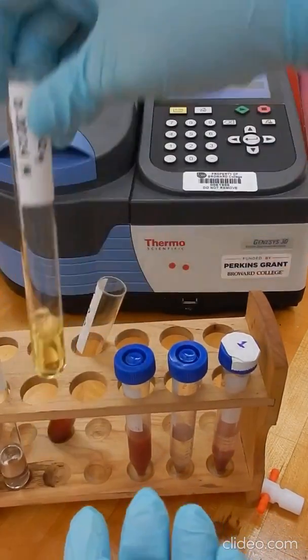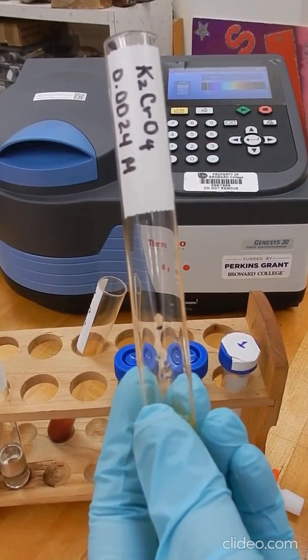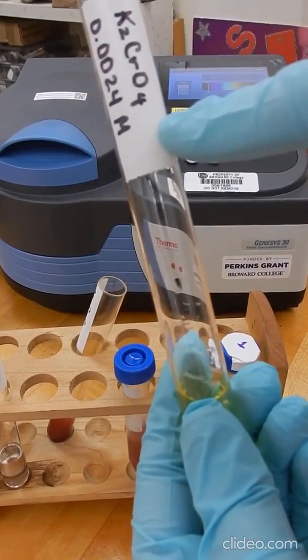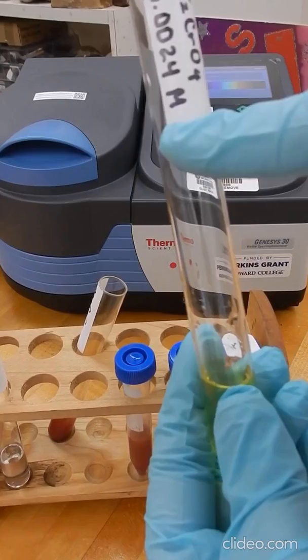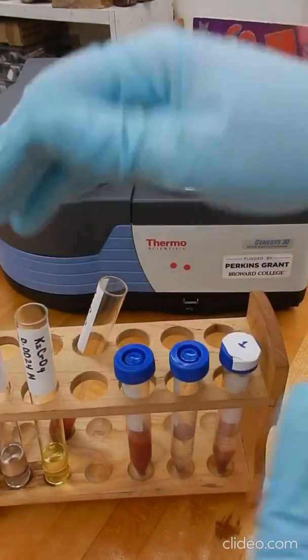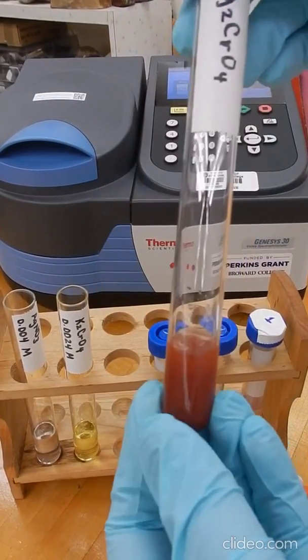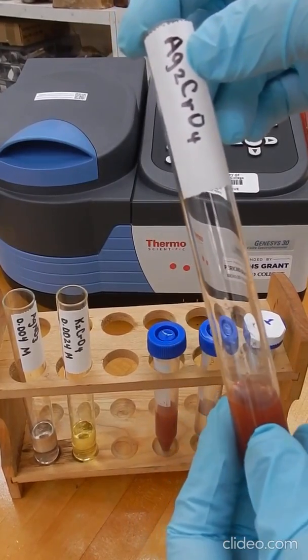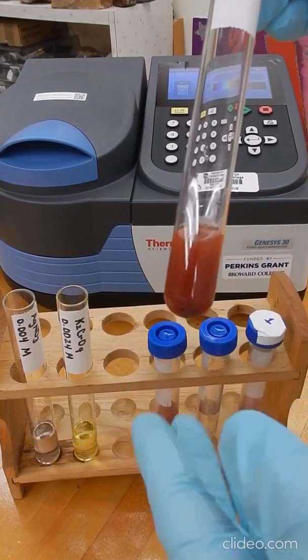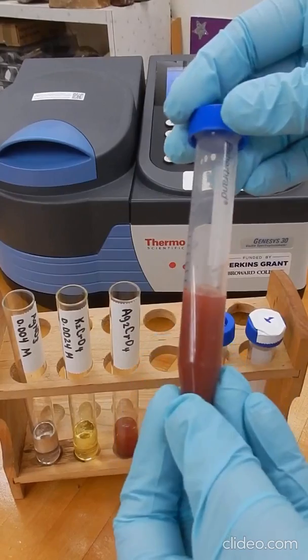And now we have our solution here for the potassium chromate, which is the one that we use to prepare the calibration plot. Also, you have the concentration for the potassium chromate solution that we're using. It's right here in the label. When we mix these 2 solutions, which are aqueous because both compounds are soluble in water, we get our insoluble compound, silver chromate. So this compound that we're forming here is a solid, and we're transferring that one into a centrifuge tube.